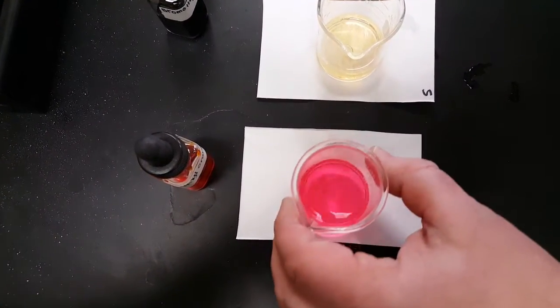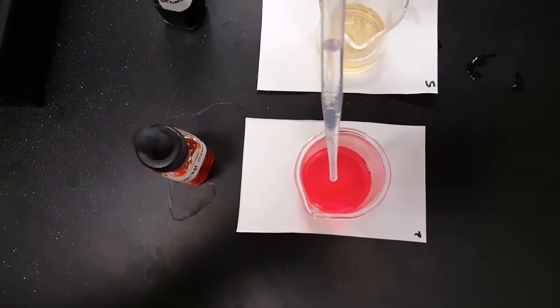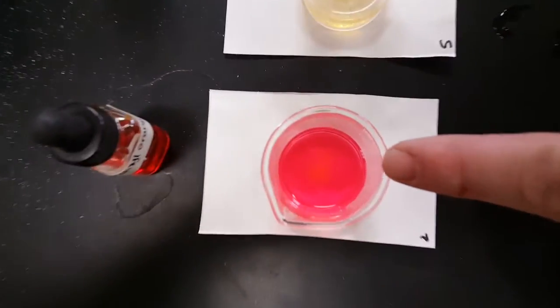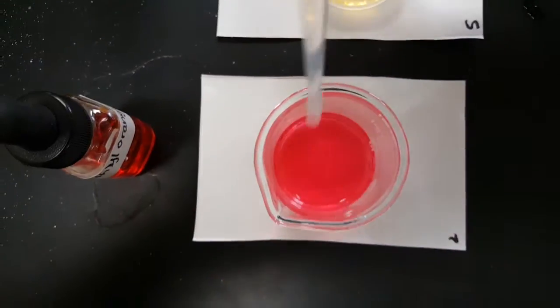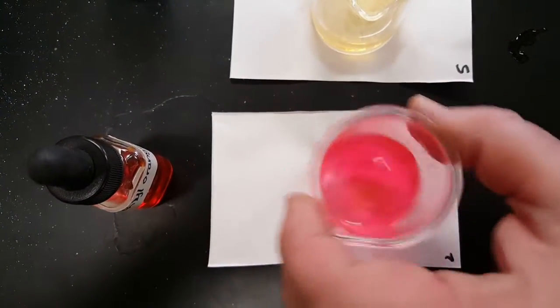Swirl every now and then. It's not about counting drops. I'm just doing that because I know when we get close. Notice, there's a little orangeness coming. Yeah, it almost shows up on the... Swirl every few drops. 1, 2. Okay, now swirl every drop. Now we'll start swirling every drop.